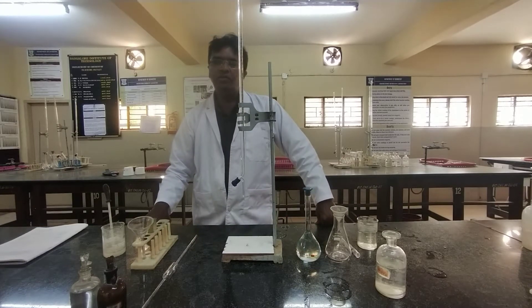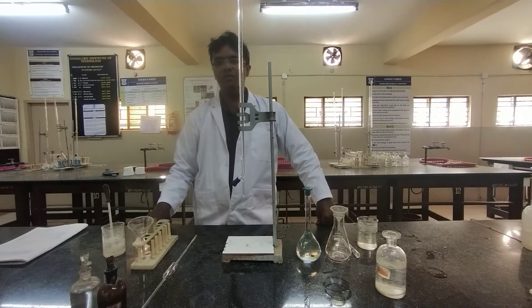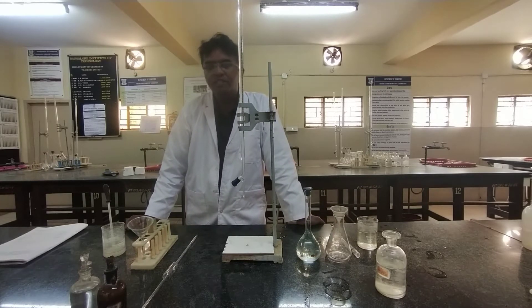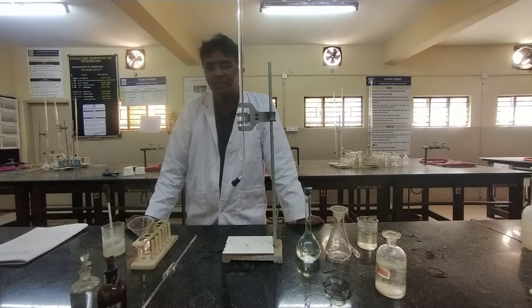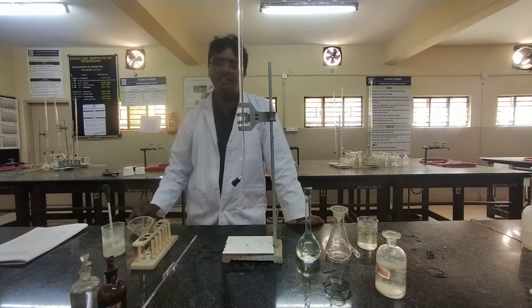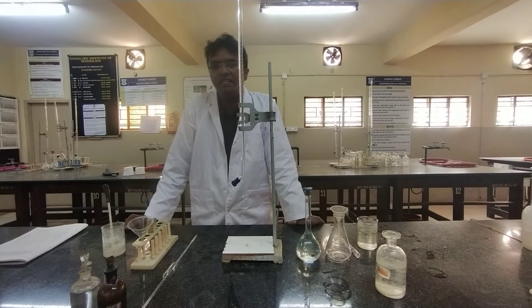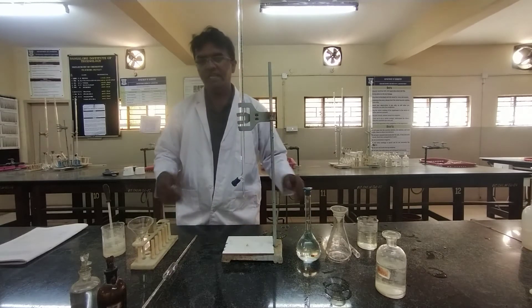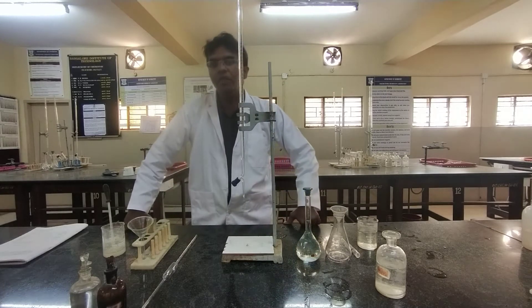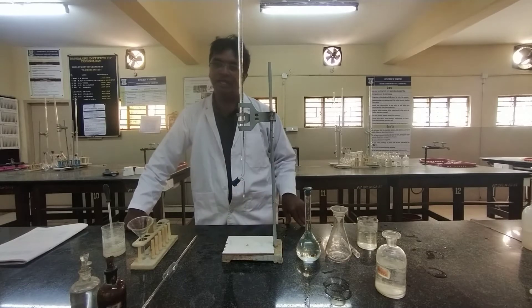Here we see how to do the experiment to find out the percentage of copper in the given brass sample. Brass is an alloy of copper — a homogeneous mixture of mainly copper and zinc. Generally any brass sample contains copper in the range of 60 to 80 percent and zinc in the range of 20 to 40 percent. Depending upon the percentage of copper present, its properties like malleability, ductility and others are decided. That is the reason we try to find out the percentage of copper present in the given brass sample.